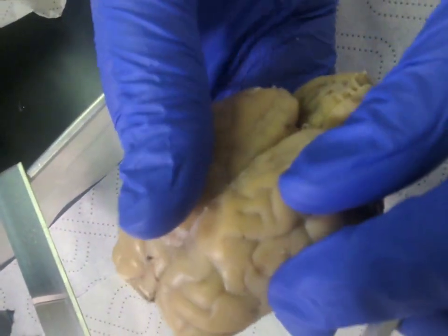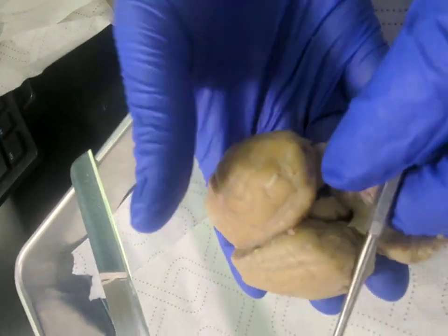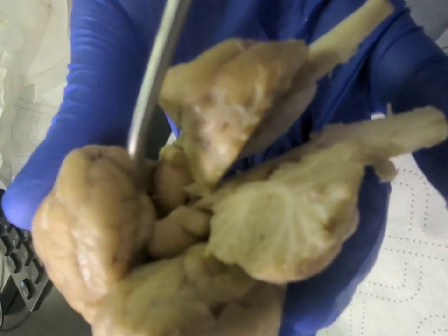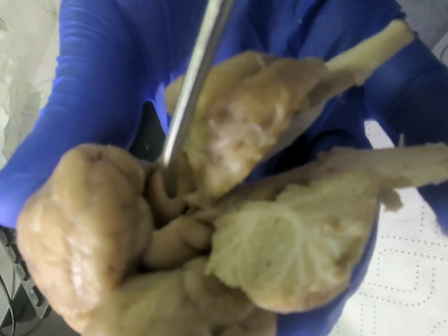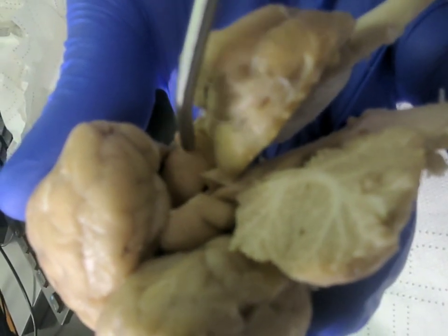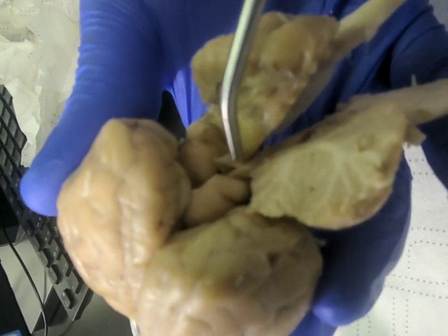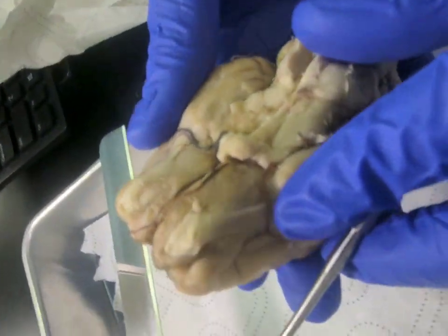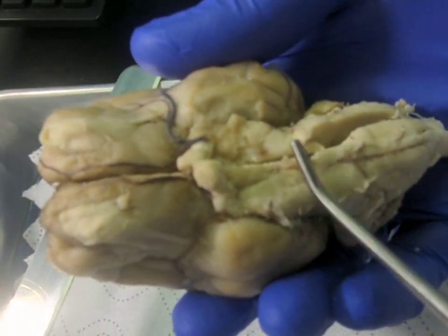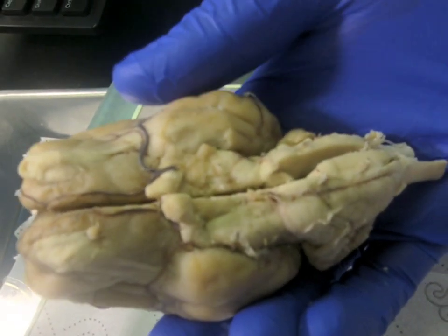And then if you come over and you pull the cerebellum apart from the cerebrum, you can see the midbrain in here, which has the superior colliculi and the inferior colliculi, or the things on the bottom. Collectively, they're known as the corpora quadrigemina. And again, that's just the midbrain. And then if we turn this back over, we can see another part of the midbrain right here. This is the brainstem that we already went over, and then right above that are the cerebral peduncles right here and here. That's also a part of the midbrain.